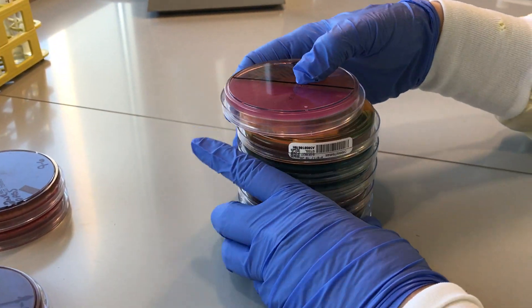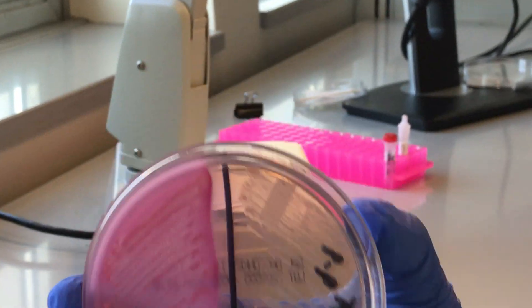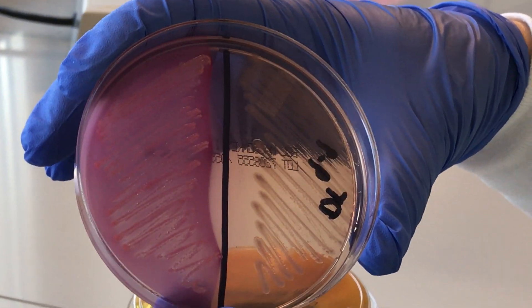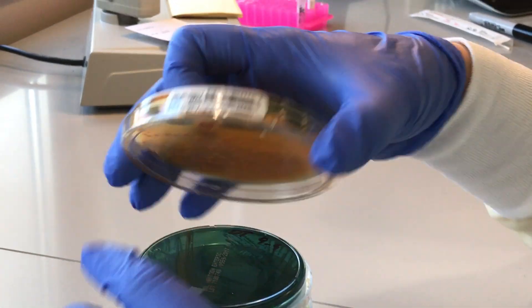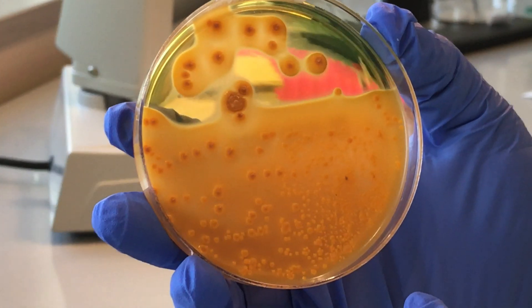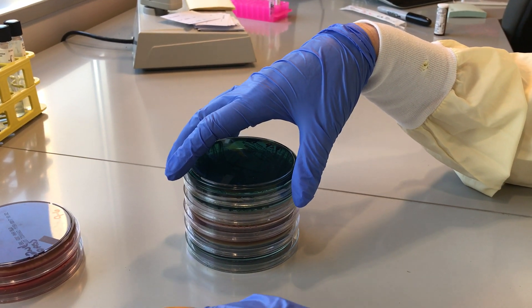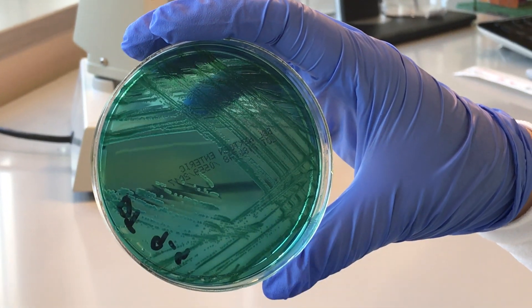Now we're going to go for some differential stuff. This is the difference between a lactose fermenter and a non-lactose fermenter on MacConkey. A lactose fermenter will turn pink; a non-lactose fermenter will be clear. On Hektoen enteric, Enterobacteriaceae like Klebsiella and E. coli will turn it orange. Hektoen enteric is basically to try and figure out if you have Salmonella or Shigella — it's a stool thing. As you can see here, this is a non-lactose fermenter and the colonies are green.